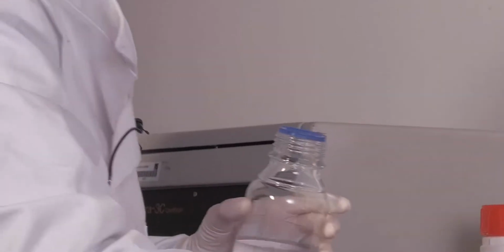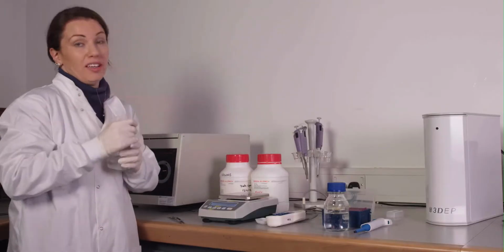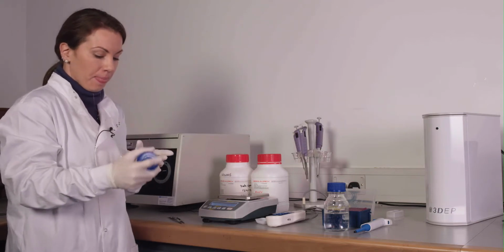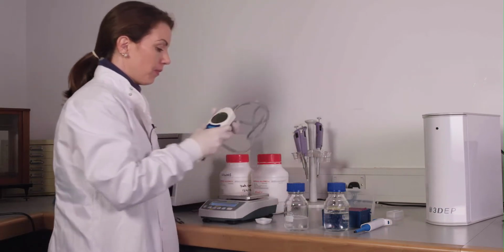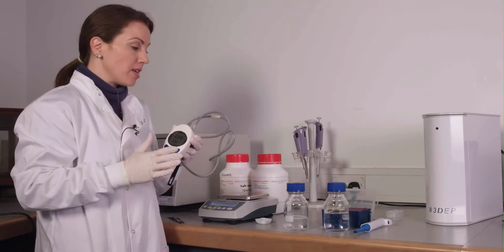You can use a stirrer, you can manually stir it, or if you've got a nice bottle, you can just shake it. And this should all dilute fairly quickly. Once the solution's dilute, you're going to want to measure the conductivity. And we'll need to adjust the conductivity to a starting point of about 10 millisiemens.